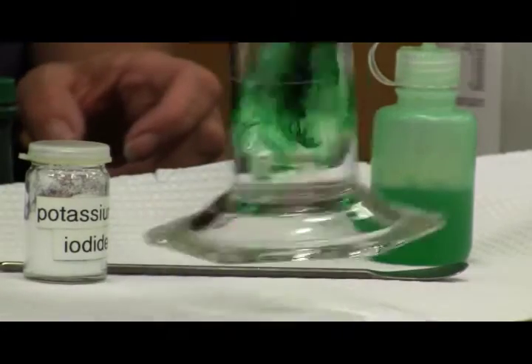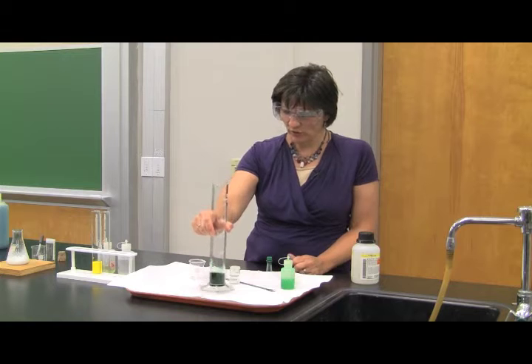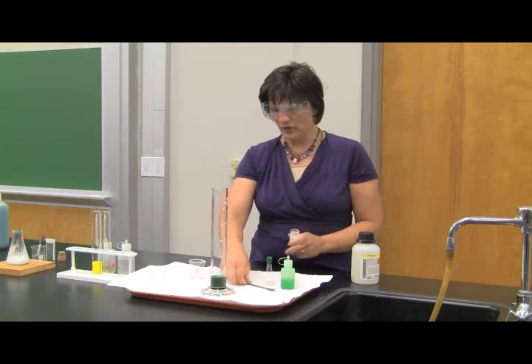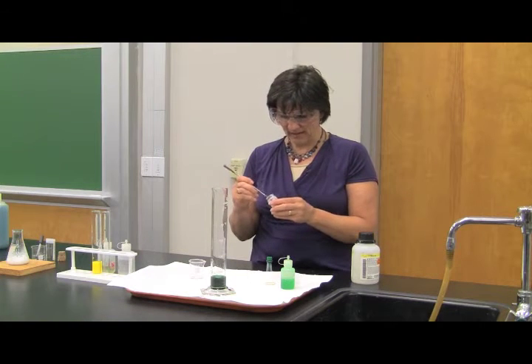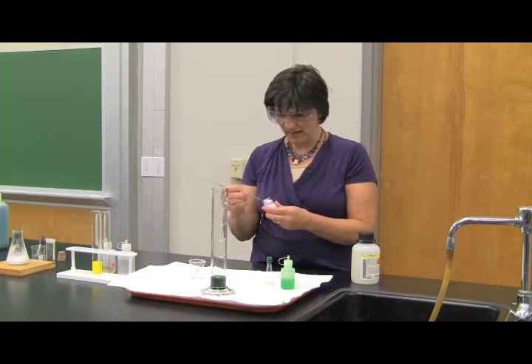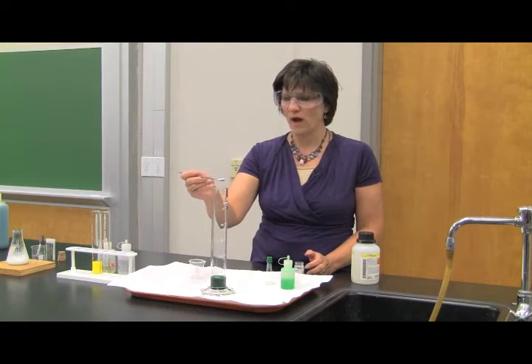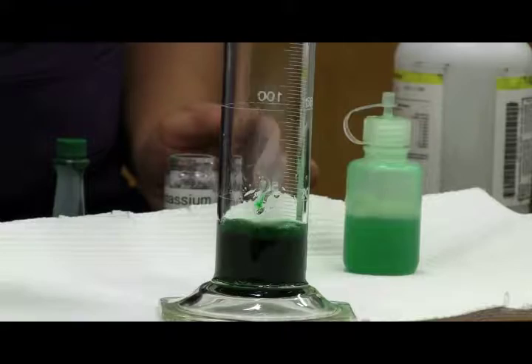All right, I'm going to mix those together. Now, hydrogen peroxide will naturally degrade and give you oxygen gas. But what I'm going to do is make this reaction take place much more rapidly by adding a catalyst. Now, this catalyst is just some potassium iodide, and I'm going to dump this into there, and then we'll see the reaction rapidly taking place, and we'll see the formation of our elephant toothpaste.